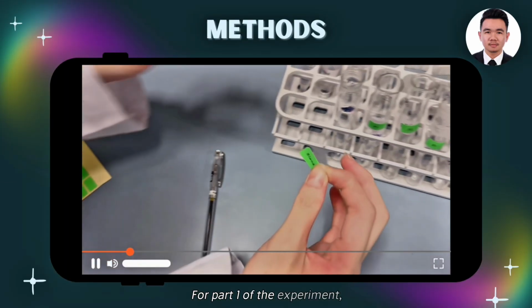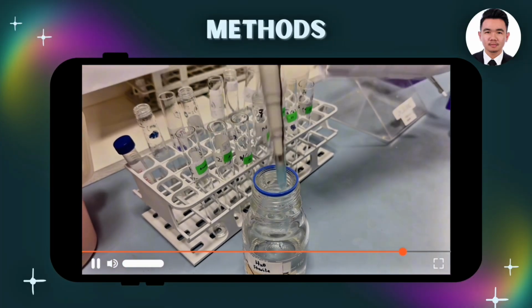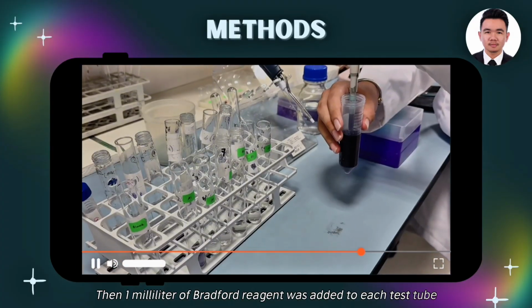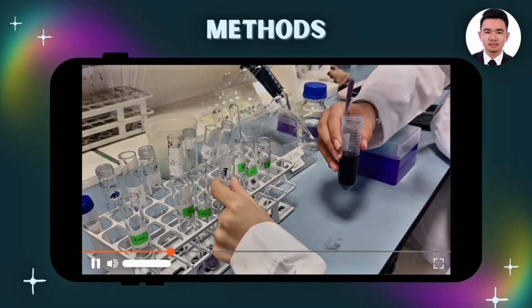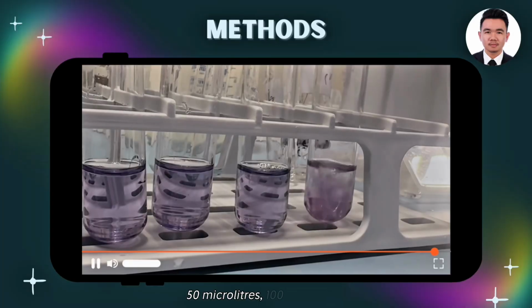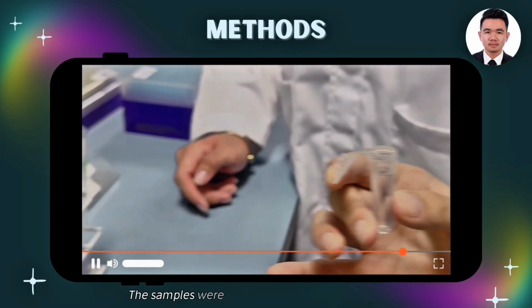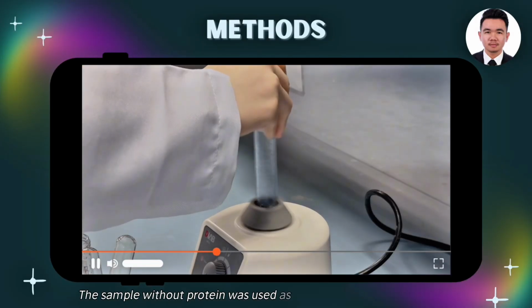For part 1 of the experiment, micropipettes were used to dispense 4 ml of distilled water into 6 test tubes. Then, 1 ml of Bradford reagent was added to each test tube. 50 microliters, 100 microliters and 200 microliters of BSA protein standard were prepared in duplicate and then added. The samples were read from the least concentrated and each absorbance was recorded.